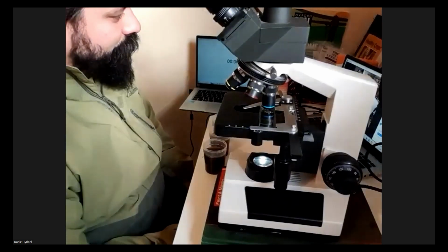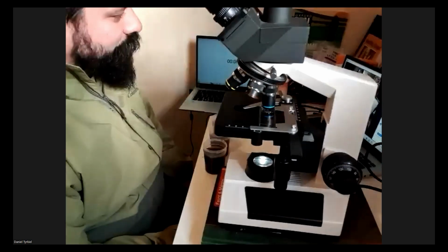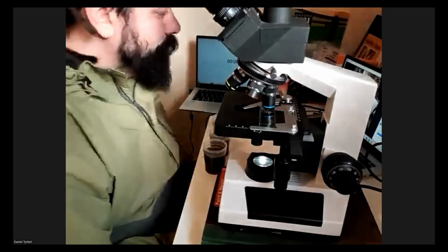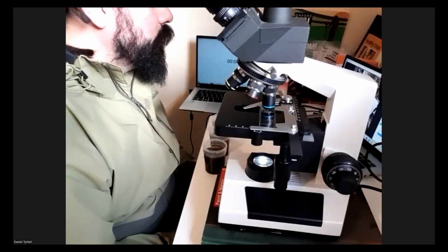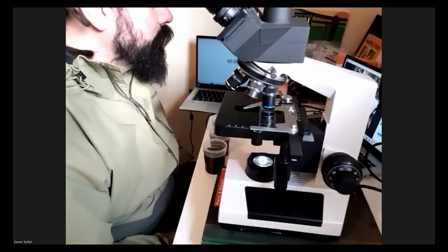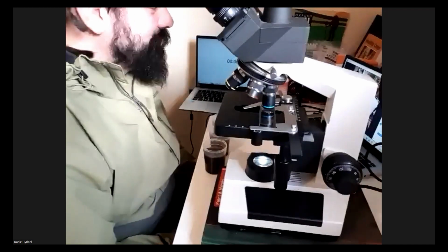It's basically a refined extract of the compost that we make, and it's very useful if you're just learning microscopy. It's useful for you to get a small amount because everything is in it, and you can very quickly identify all of these microbes without going around and searching for them. For the longest time, when we were starting, we didn't have a material that we could see everything in. So it's a really good reference resource. You can literally get it ordered to your house. You don't even have to leave the house. Exactly. No need for trips to Woodlands.